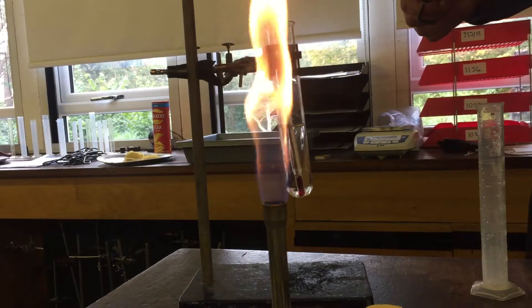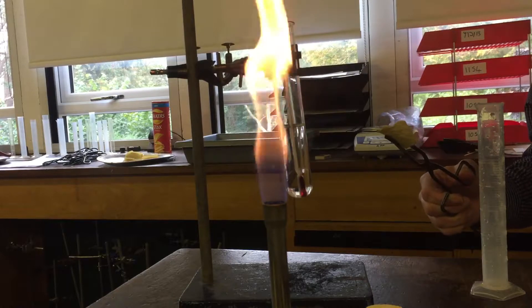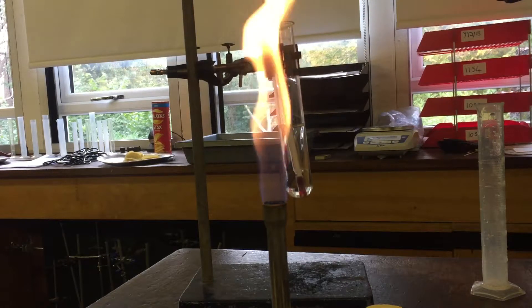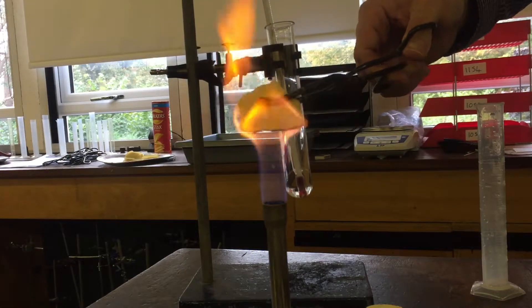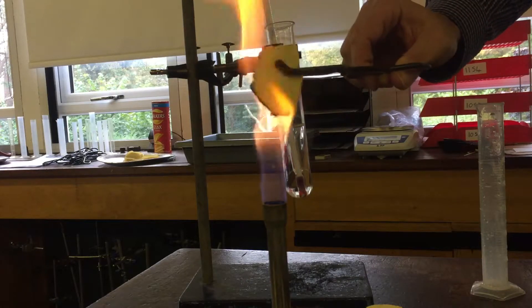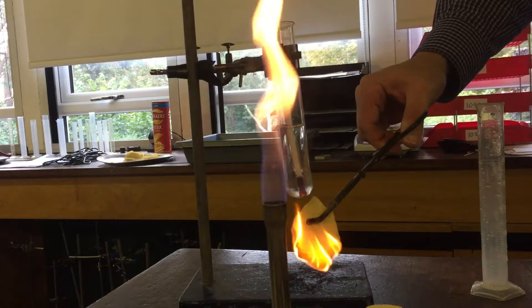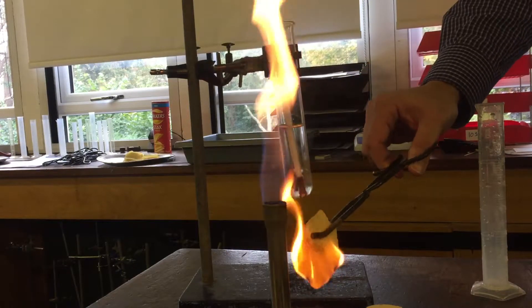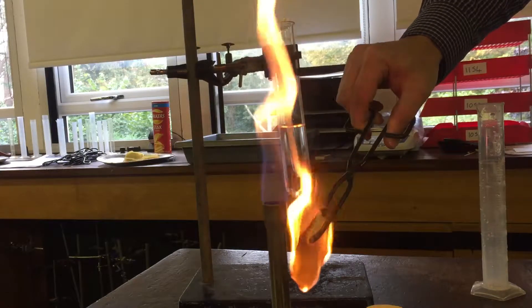Keep burning until the crisp is completely burnt out. I've got my water, I'm taking the starting temperature — at eye level the temperature is 22°C. Make sure you get down to eye level to measure the temperature, then put it into your table. Ignite the food. Once it's burning on its own, hold it under the boiling tube. Turn it so the flames are going up the crisp, and keep rotating it — holding it about 5 centimetres away — being careful not to get your hands too close.